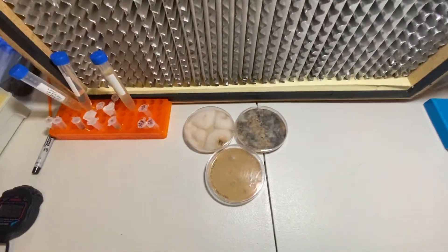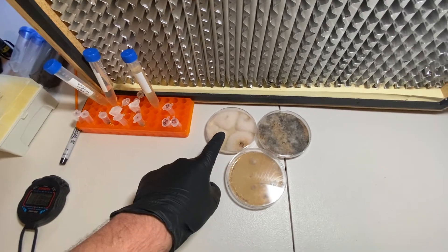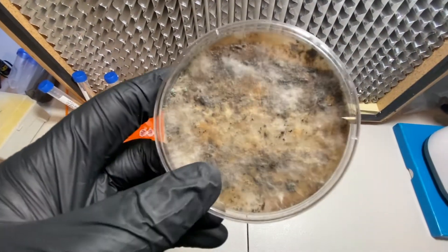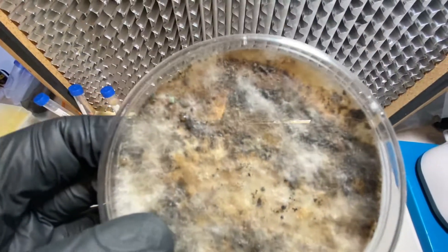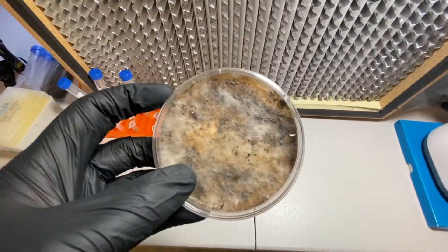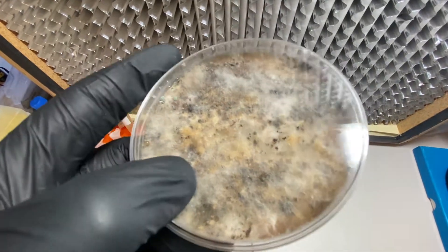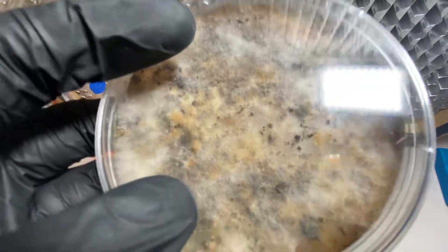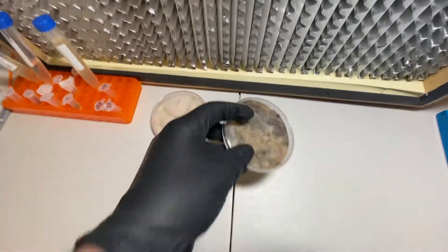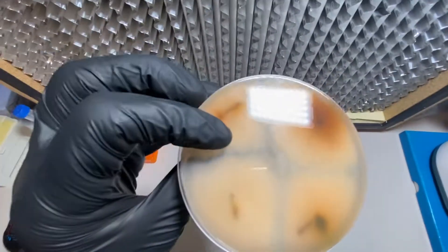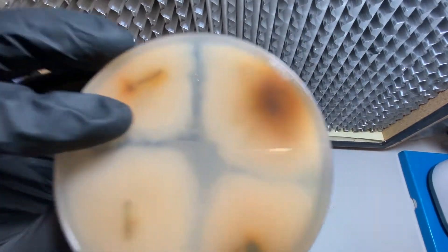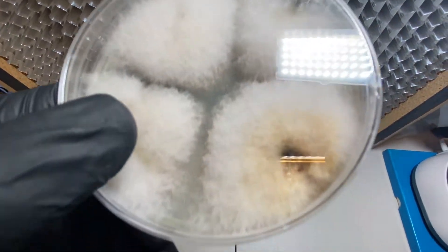We're about a little over a week out from collecting those LA River samples. I showed you how we started with a full dilution of the soil sample, and this is what it's grown out to. Each of those little black spots and all the different colors are different species of fungi. As I suspected, that's too high of a suspension because it's really difficult to try to get one species and transfer it to a new plate. It's probably impossible now unless I get lucky. The grass we cultured is producing that beautiful ombre pigment, and the colonies are starting to grow together.